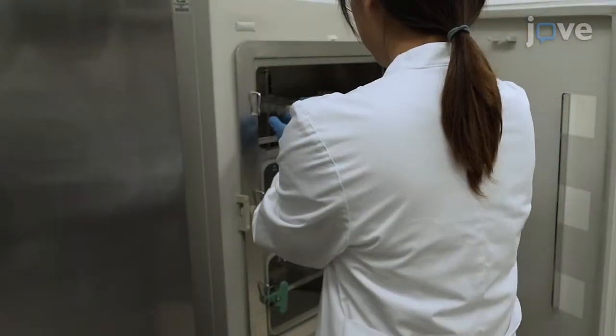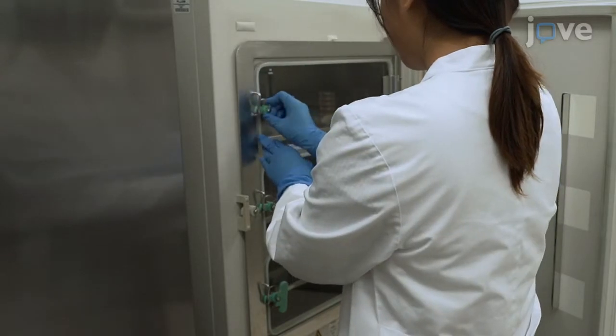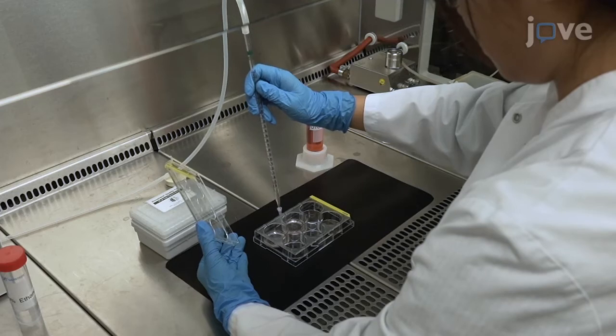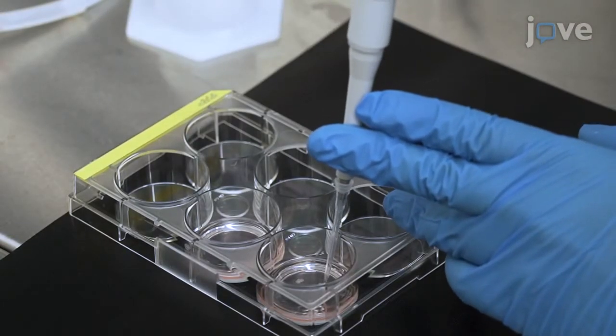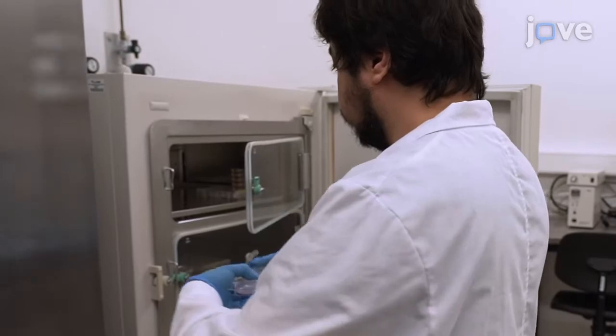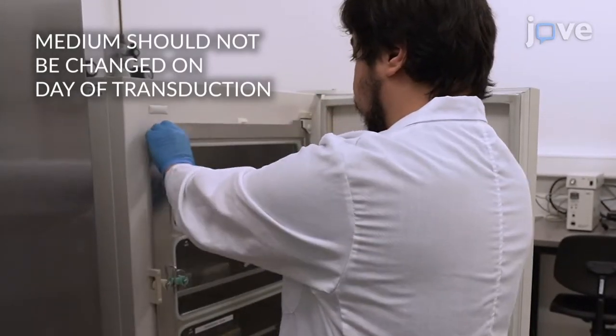Keep the cultures in a humidified incubator at 5% carbon dioxide and 37 degrees Celsius until the day of the experiment. Replace the medium every 2 to 3 days. Without touching the tissue, apply 0.5 microliters of the diluted vector directly to the top of each slice. Finally, place the slices back into the incubator and maintain them there for at least 6 more days.